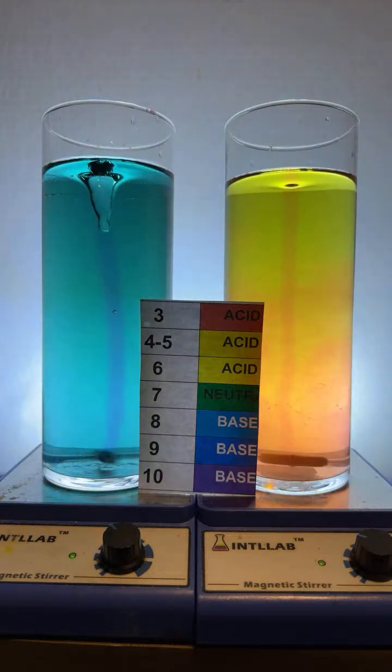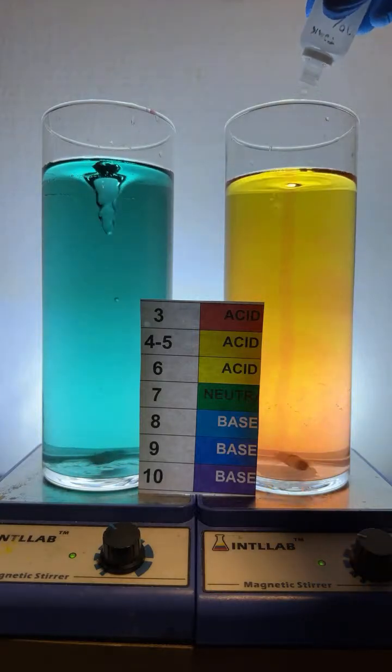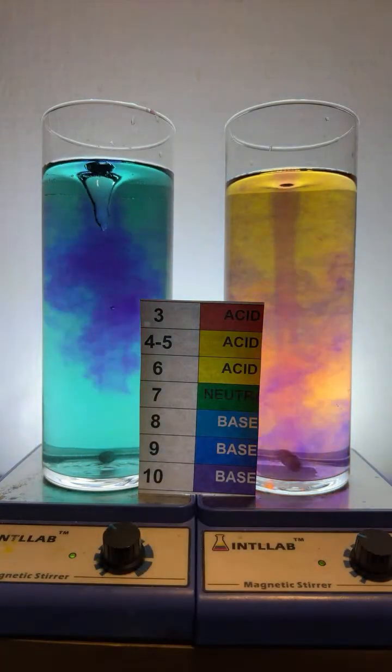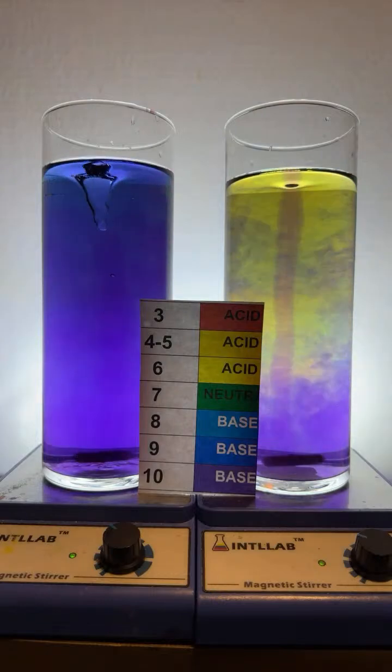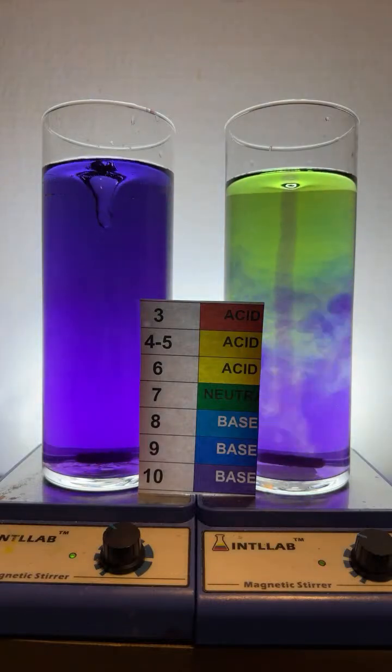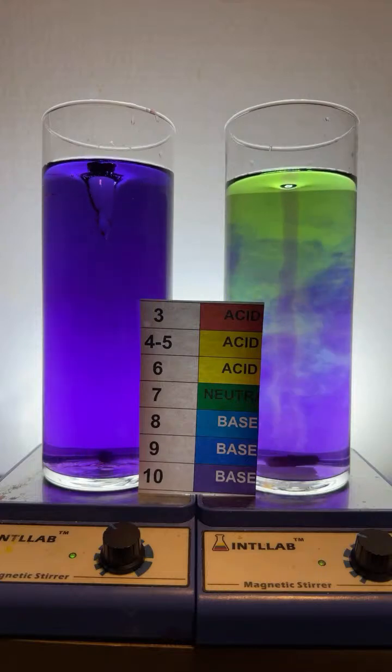Christy tried to adjust the pH of a fish tank once, and the buffers kept bringing it back to neutral, and then it crashed. Okay. So, yeah, what a buffer is, a system. Here, let's just show you. Let's make a buffer, all right? Before I make the buffer, just check this out.